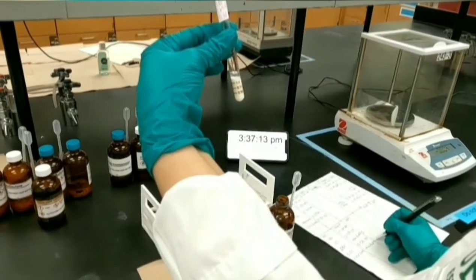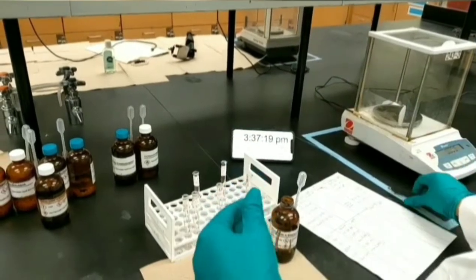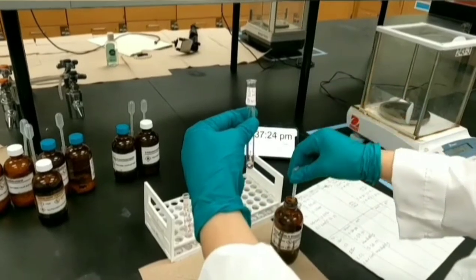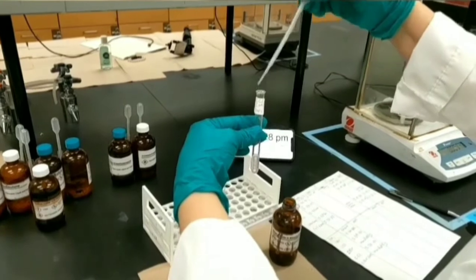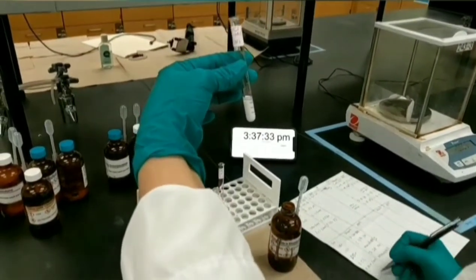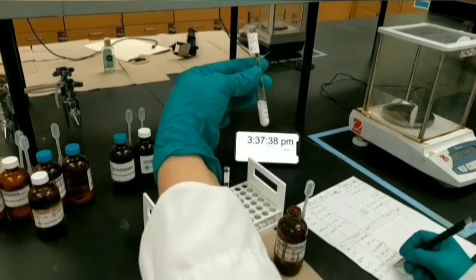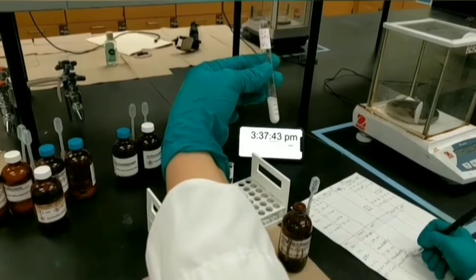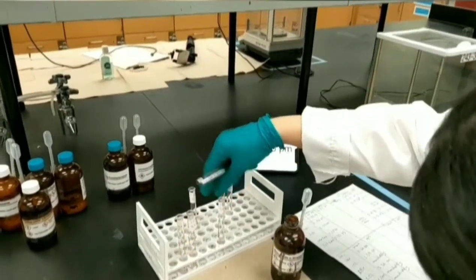This reaction also is completed. I can put it over there, and I'm going to add nucleophile to the last test tube of 2-chloro-2-methyl propane. It also reacted immediately. You don't need to record any time, just write it reacted immediately and made a precipitation. This reaction also is completed and we can put it over there. I'm going to check other test tubes.